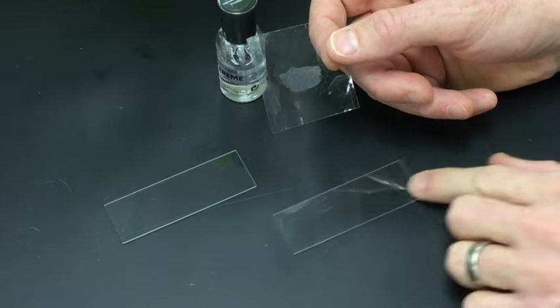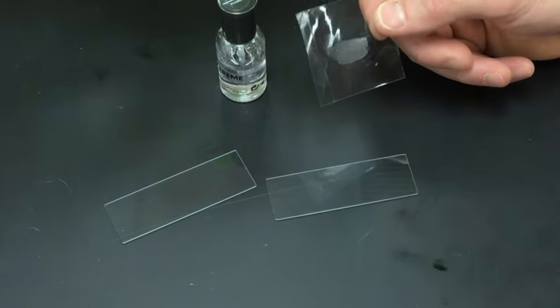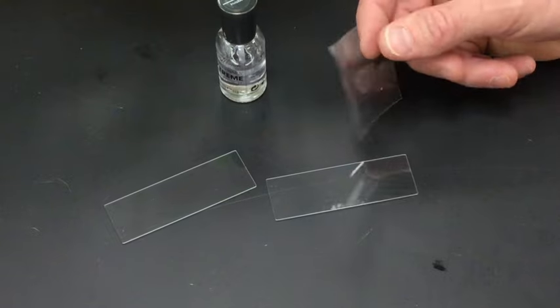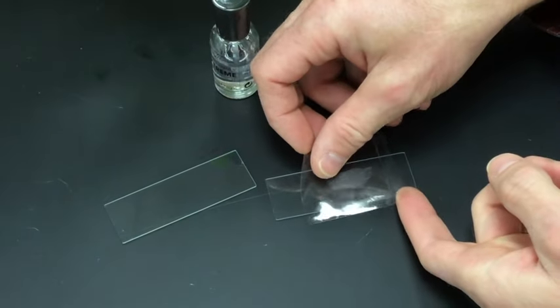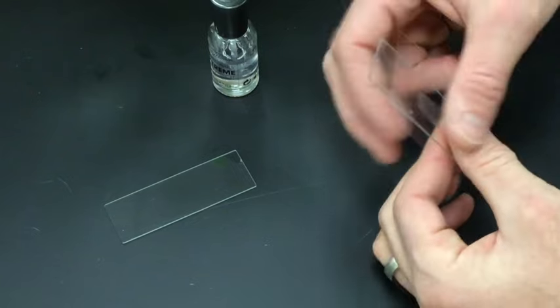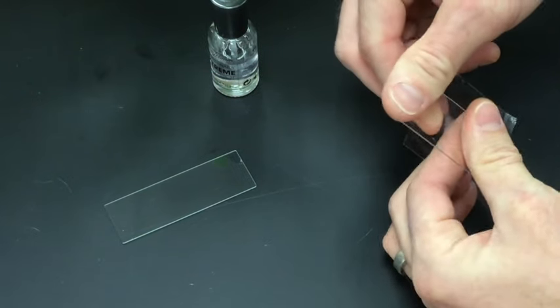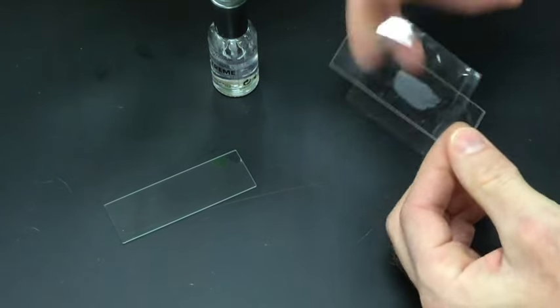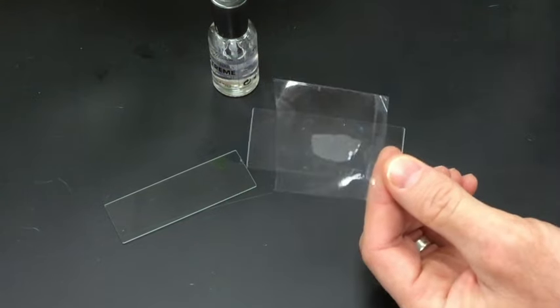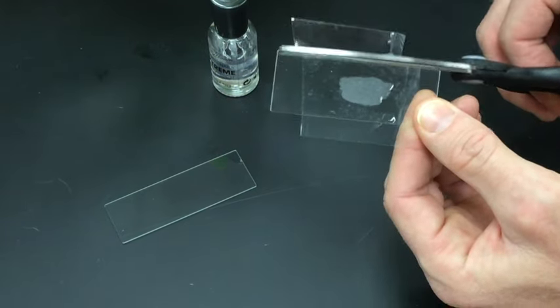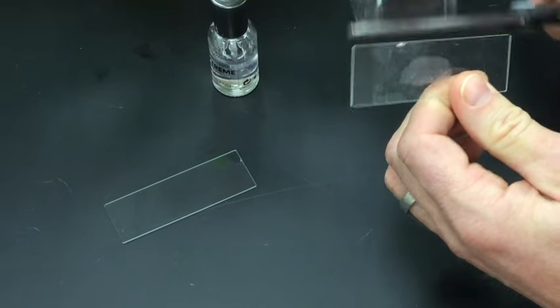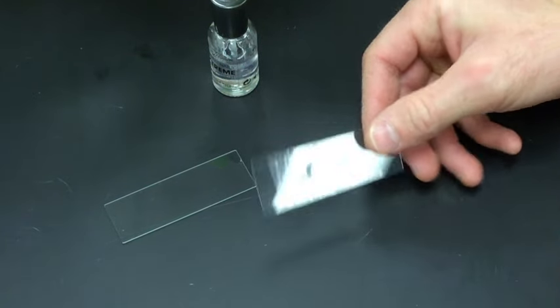So I want to put that on a slide. Try to make sure your slide is also clean of fingerprints and dirt, because it'll just make it harder to see things. Press the slide, stick your side onto the glass. You've got some excess tape, you can trim that off. Okay, there's one slide.